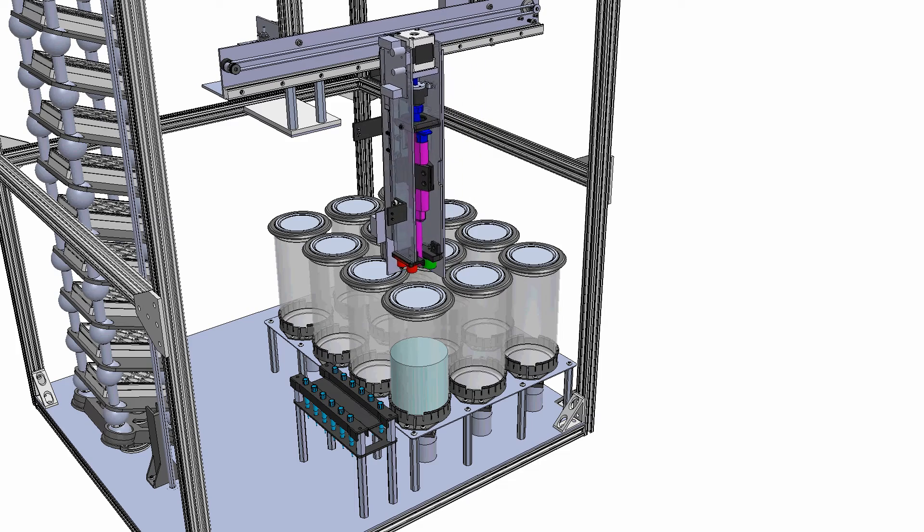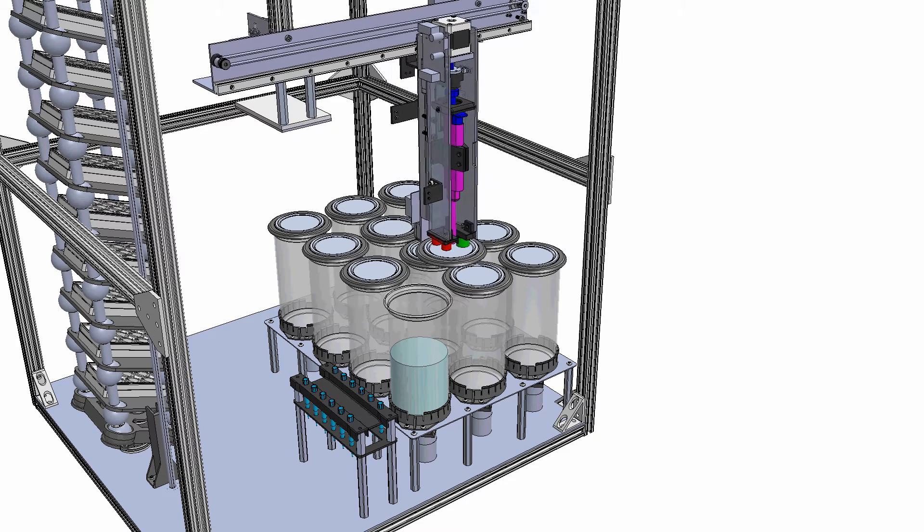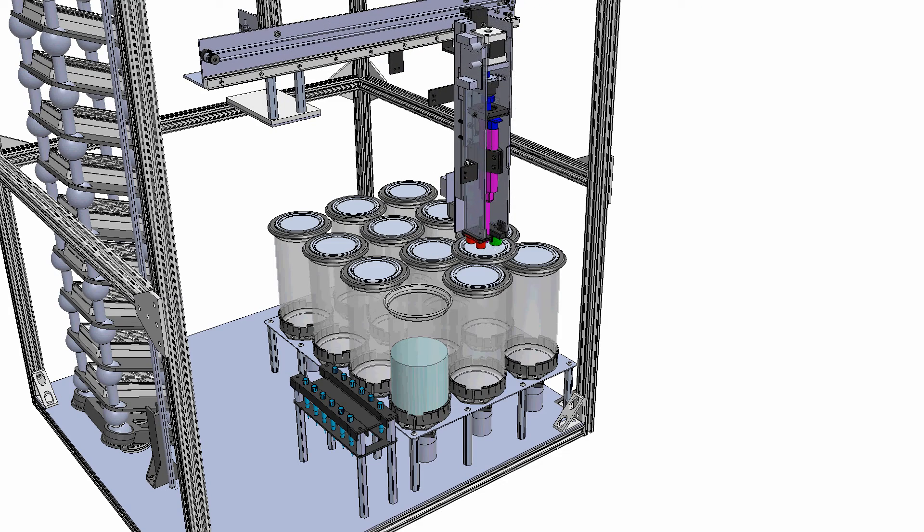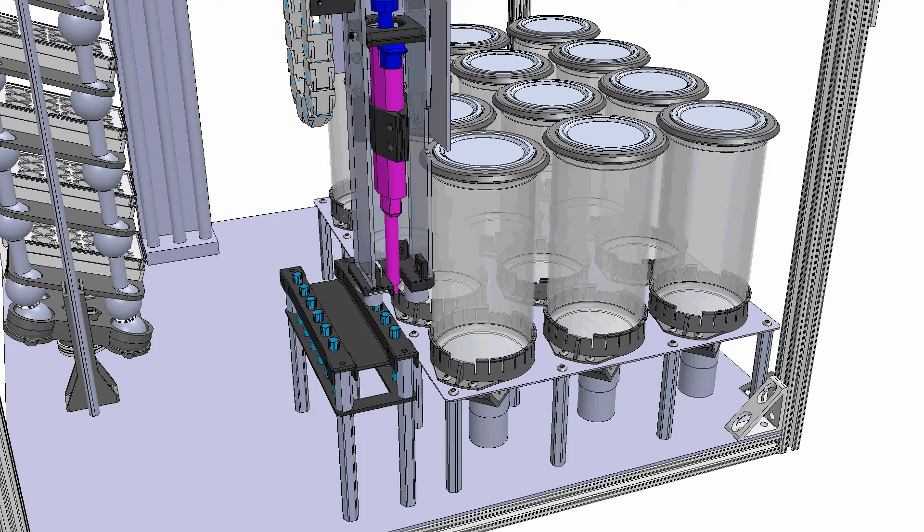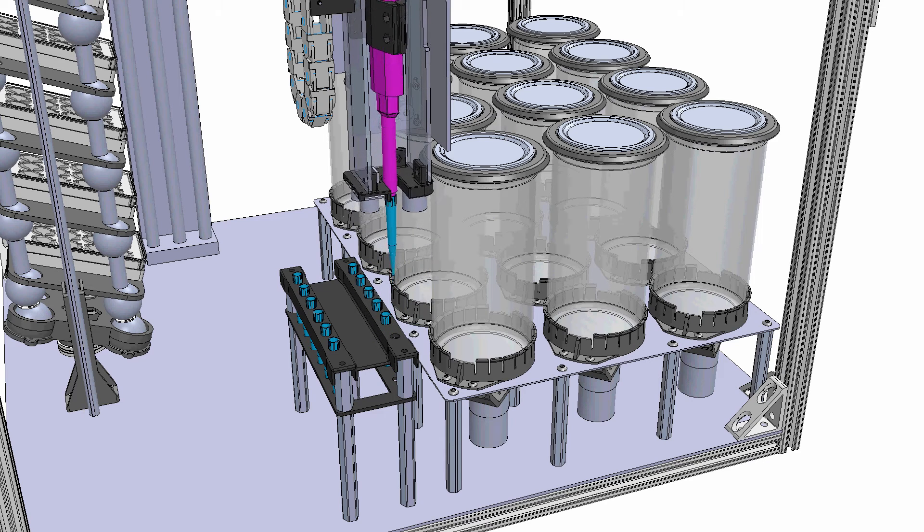The pipette assembly with no tip is moved over a beaker. The green electromagnet is engaged and the lid is lifted and moved. Each beaker must have its own pipette tip to avoid cross-contamination between the bacterial mixtures. The tip associated with the beaker is attached to the pipette.